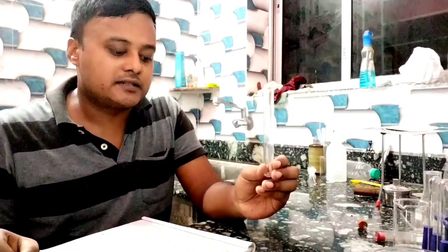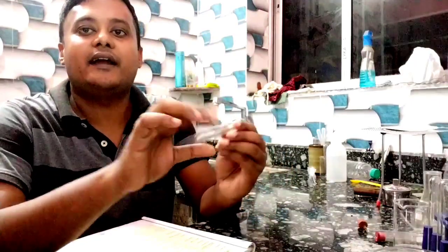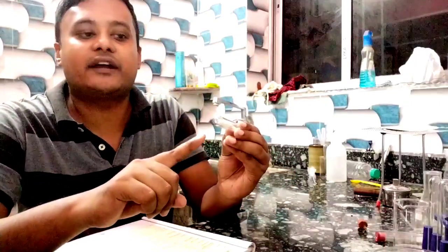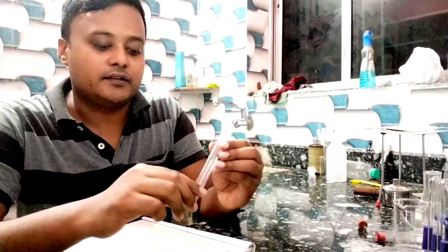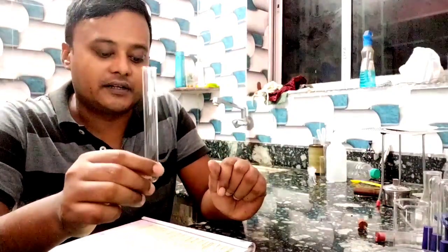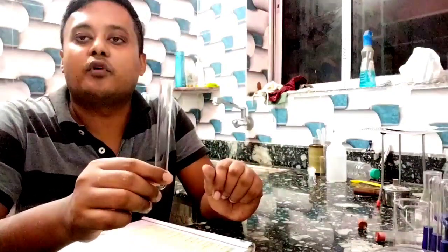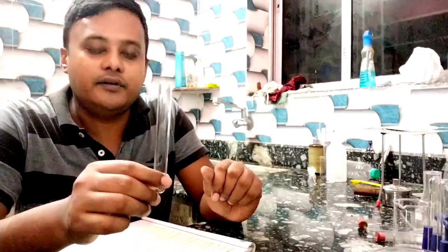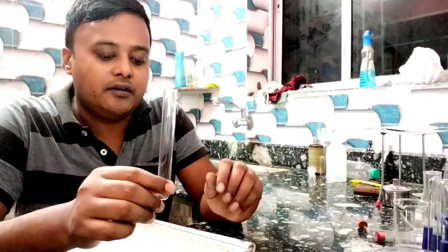It is a glass tube, open at one end and round at the other end. Its use is to study or heat a small quantity of reagent or chemicals.